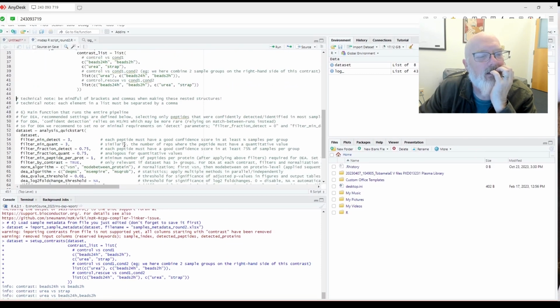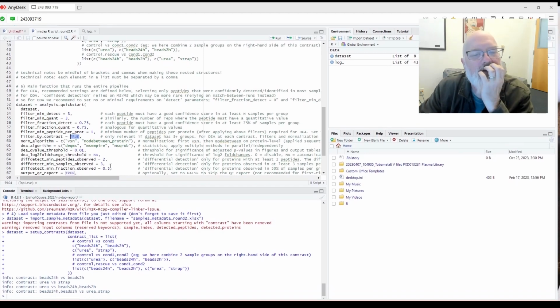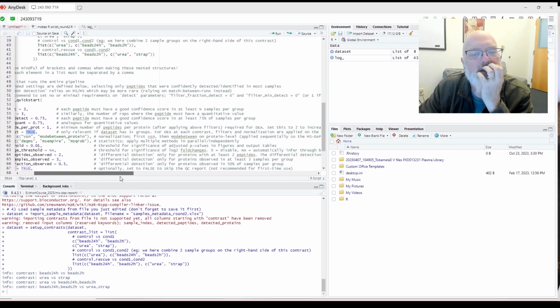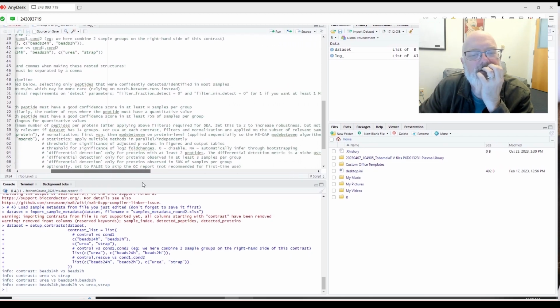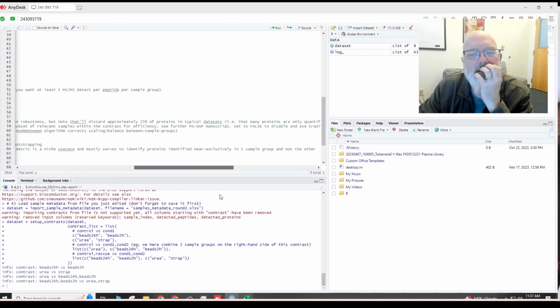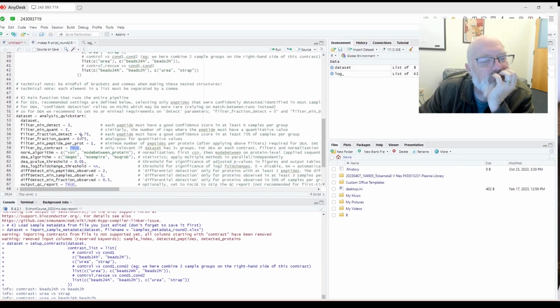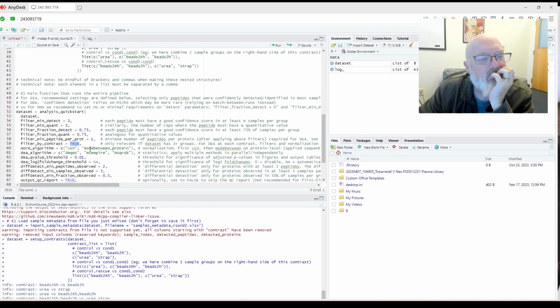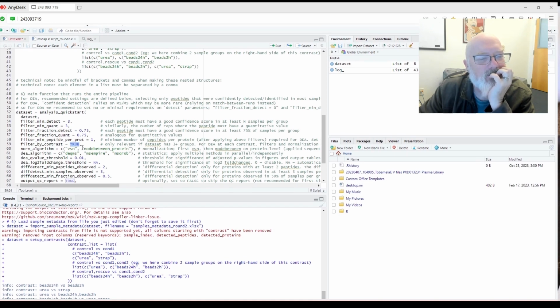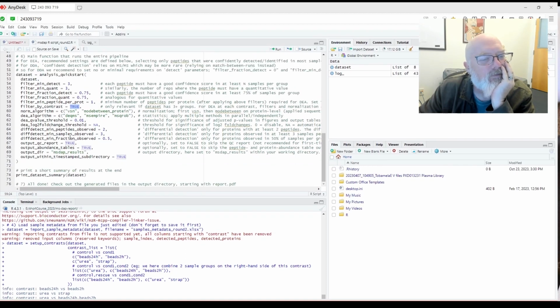And then what I'm going to do is change this filter by contrast. Only relevant if the data has 3 groups. For DEA contrast filters, I guess we keep this as true. I think we keep that. Set to false to disable. I think we leave that as true. So normalization algorithms, mode between protein, VSN. I'm going to have to go back and read what that actually means. Report QC, report abundance tables.